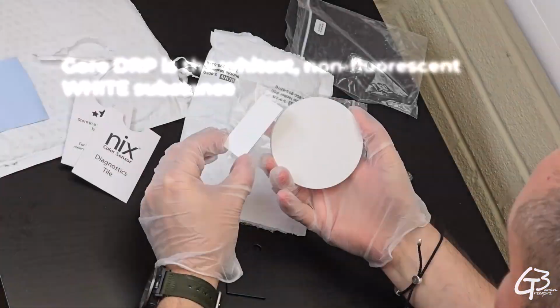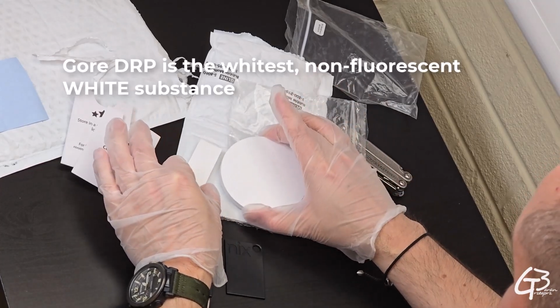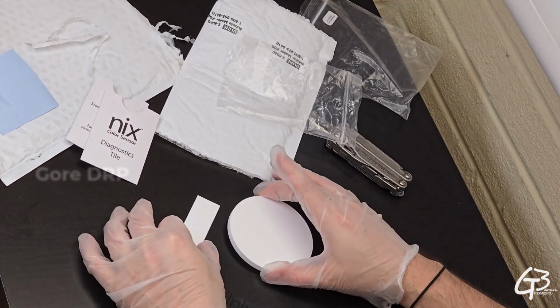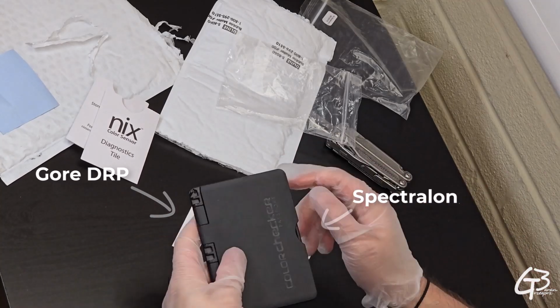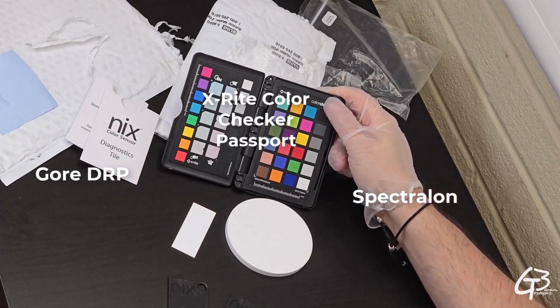For those who have no time or patience to watch the entire video, here is a quick summary. Gore DRP is definitely the brightest non-fluorescent surface I ever measured. It's almost 100% white in both linear and sRGB space. Spectralon is also extremely white, but it's a volume scatterer, so it appears darker during measurements.